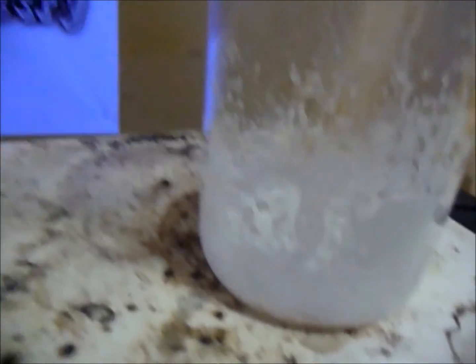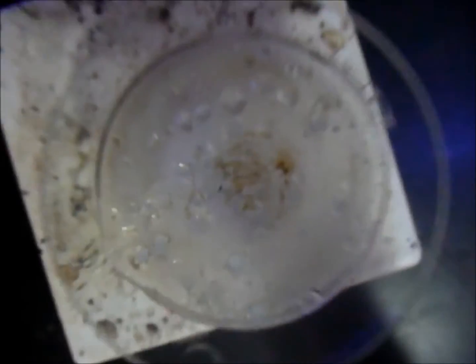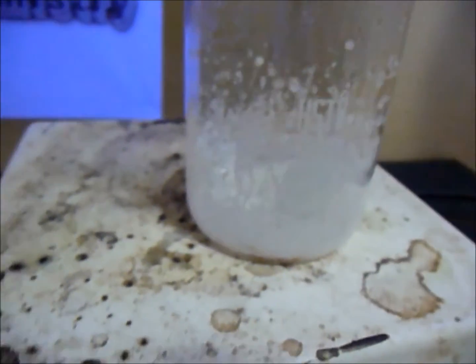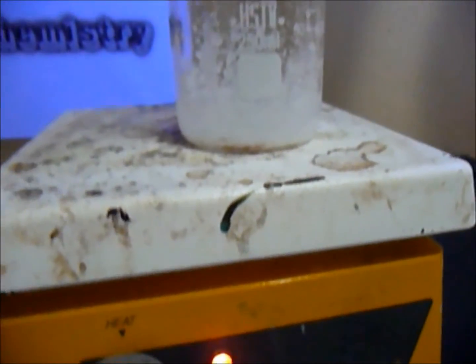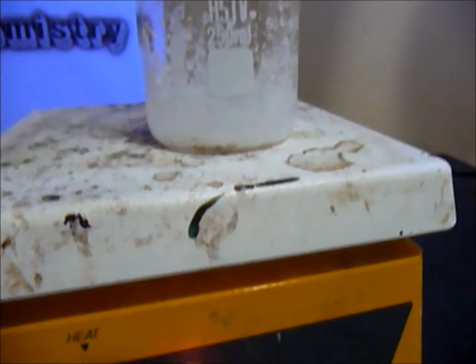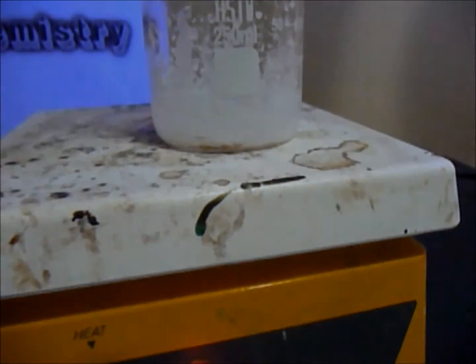Now it's really close to a powder, and you can see it starts turning all white. I'm just waiting here, so I'll show you the finished product.